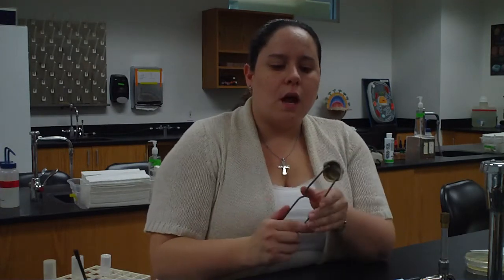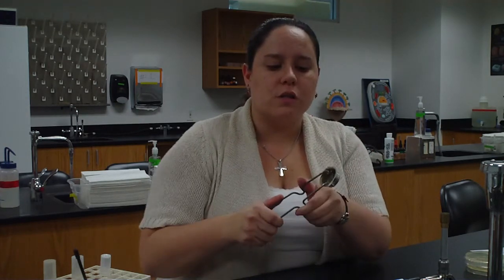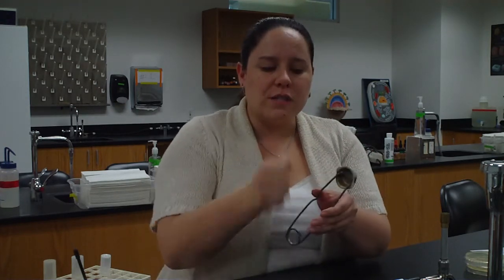We've got something called a striker. What you want to do with the striker, it has a little piece of flint. When you push on it, you want to grind the flint against the metal portion so you get a good spark like that. If you just keep squeezing it back and forth, back and forth, all you're going to do is wear out the flint and you're not going to get any sort of spark. So in class, you want to practice that a little bit.